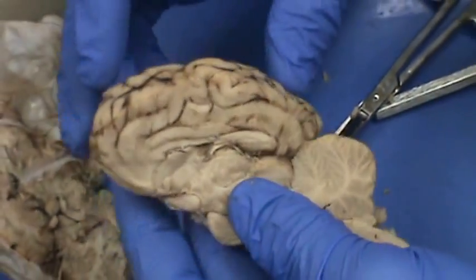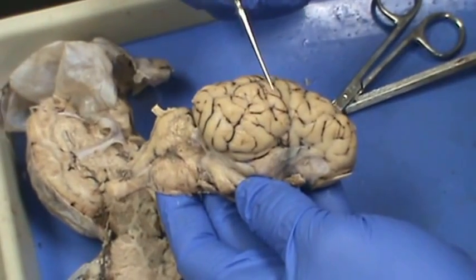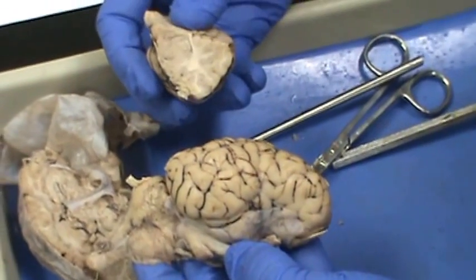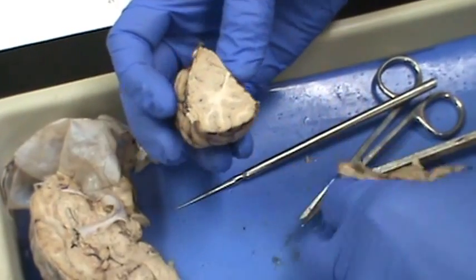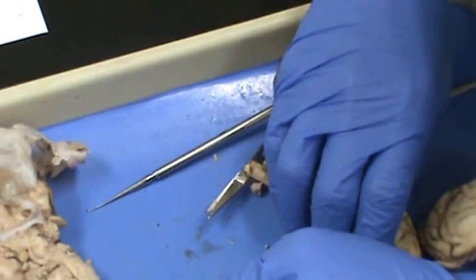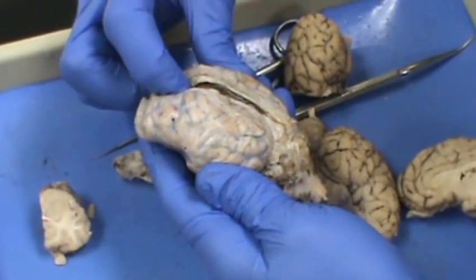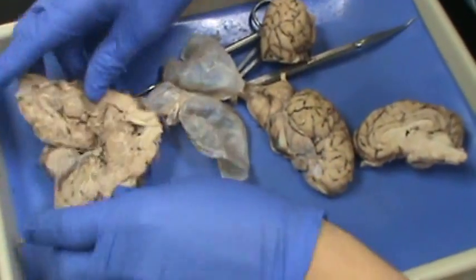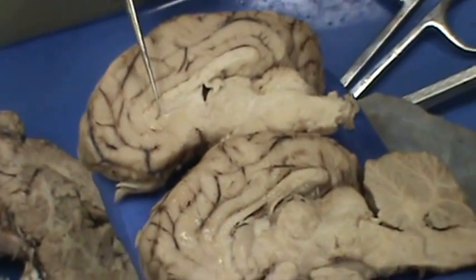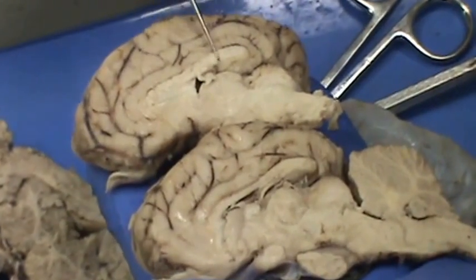Let's review. The larger part of the brain is the cerebrum. The gyrus is the raised area and the sulcus is the individual wrinkle. The cerebral cortex is the outer 2–4 millimeters, which is gray matter — the inside is white and the gray is on the outside, and you can see it follows the wrinkles. The longitudinal cerebral fissure is the deep groove between the two cerebral hemispheres, so the hemispheres are not connected until you get down to the corpus callosum. The corpus callosum is this white C-shaped structure.